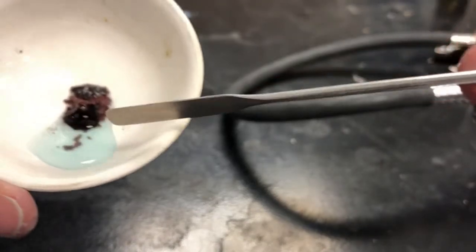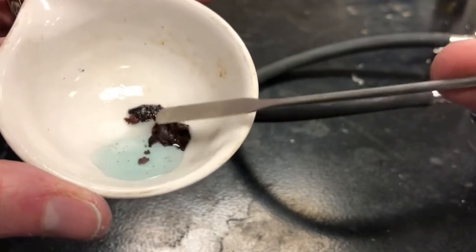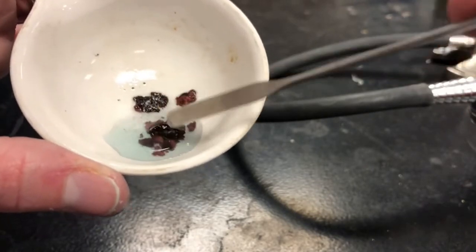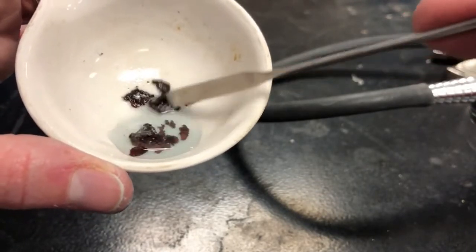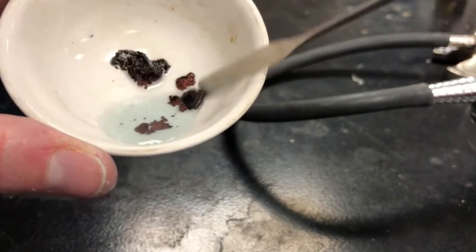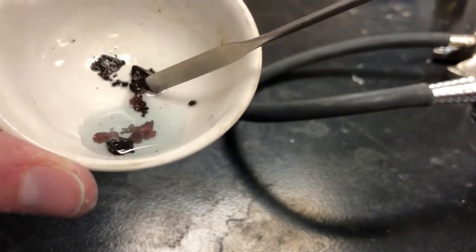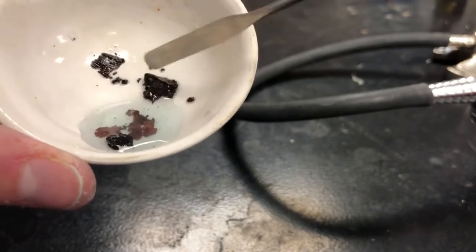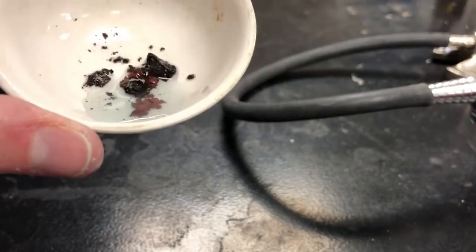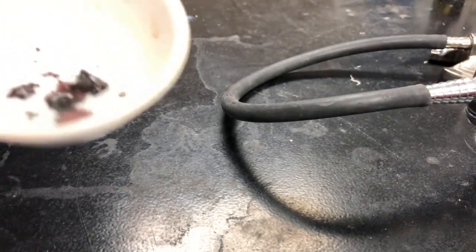So I can definitely see that the blue color is less blue, and this solid, it's this brown color. Definitely this texture is different from before. This was a very solid piece of metal before. I still have a solid piece of metal here, but this just seems a bit more flaky. So be sure to record your observations there for experiment 4.